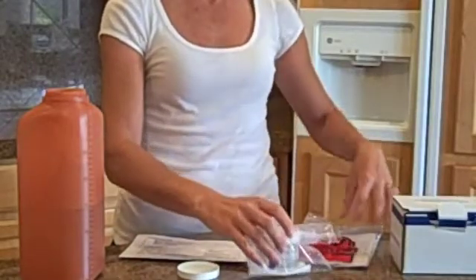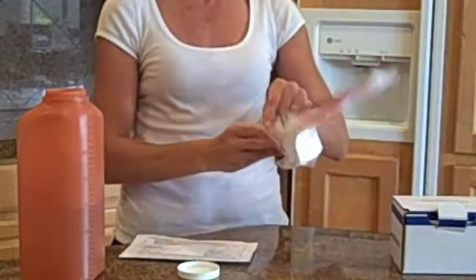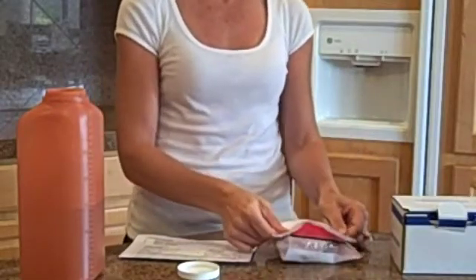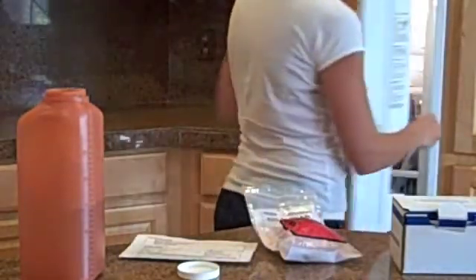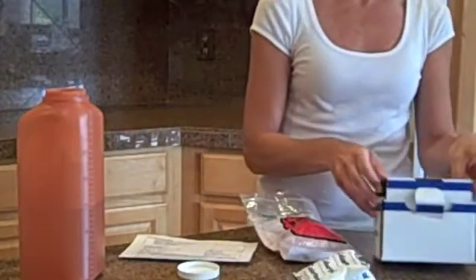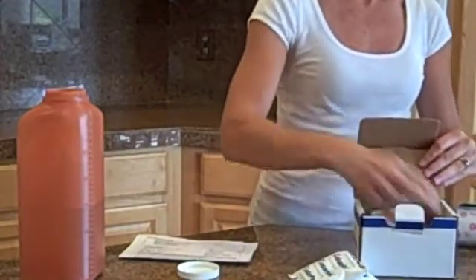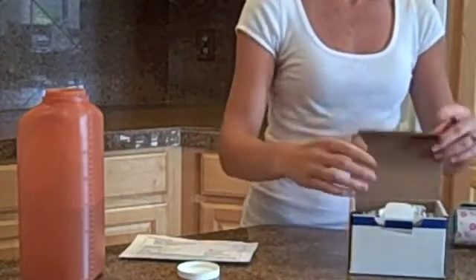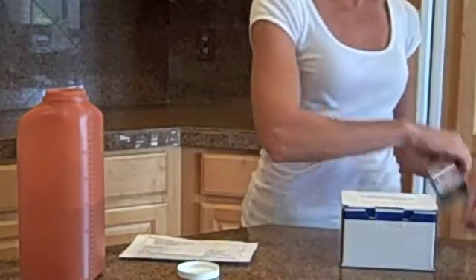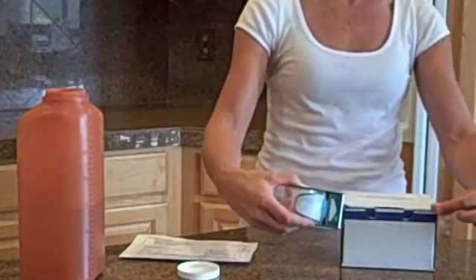Then place the specimen container along with the provided absorbent material inside the smaller clear zip bag. Finally, place the zip bag inside the plastic biohazard bag. You can now remove the coolant packs from your freezer and place both of them, along with the biohazard bag, in the blue and white shipping box provided. Then tape the closure of the box with shipping tape — only one strip and only on the edge where the box is sealed.